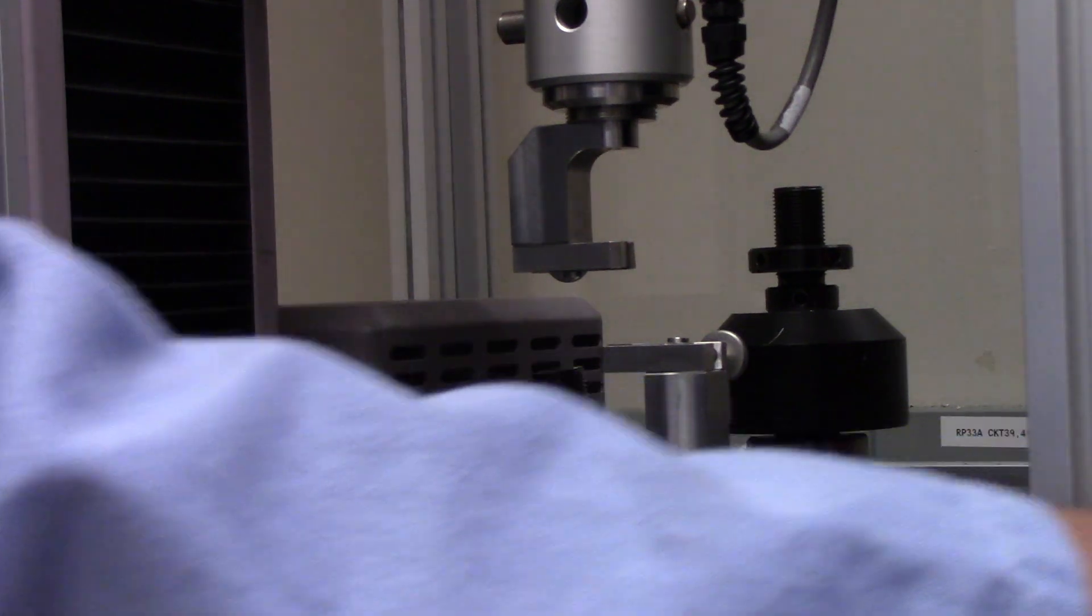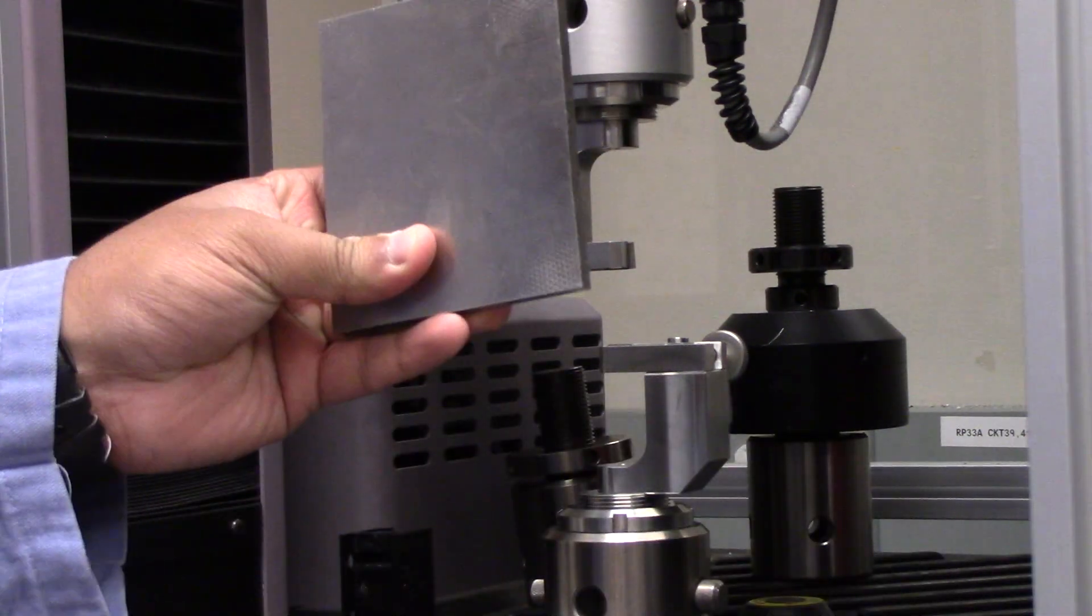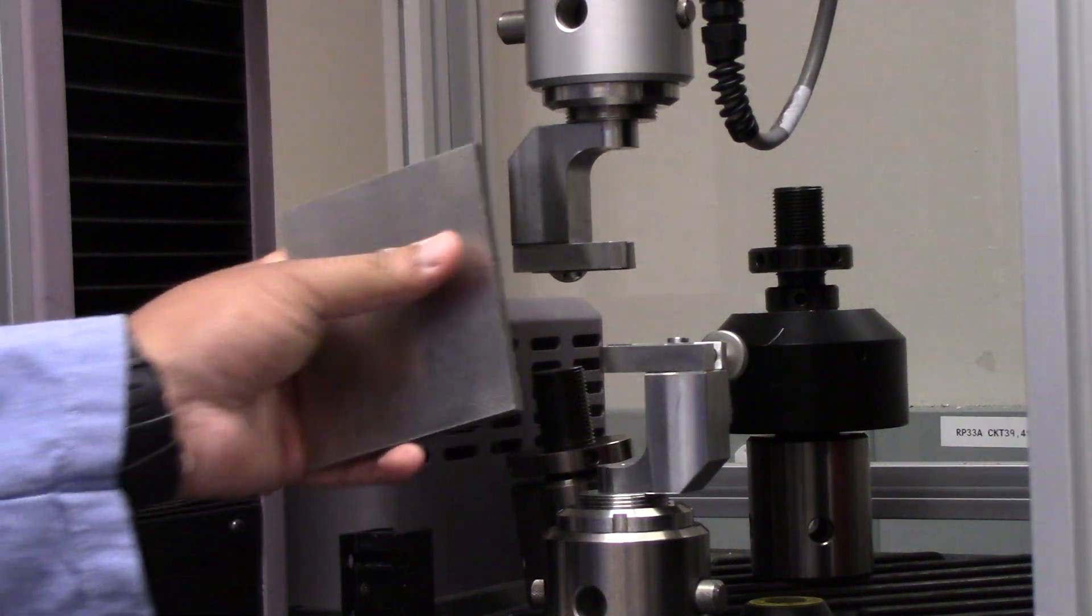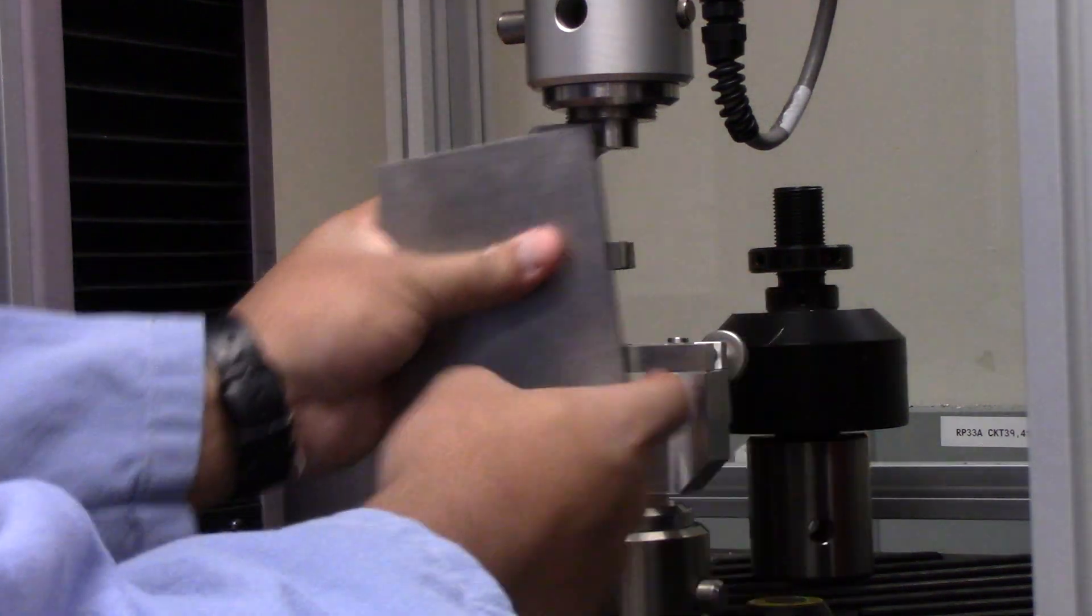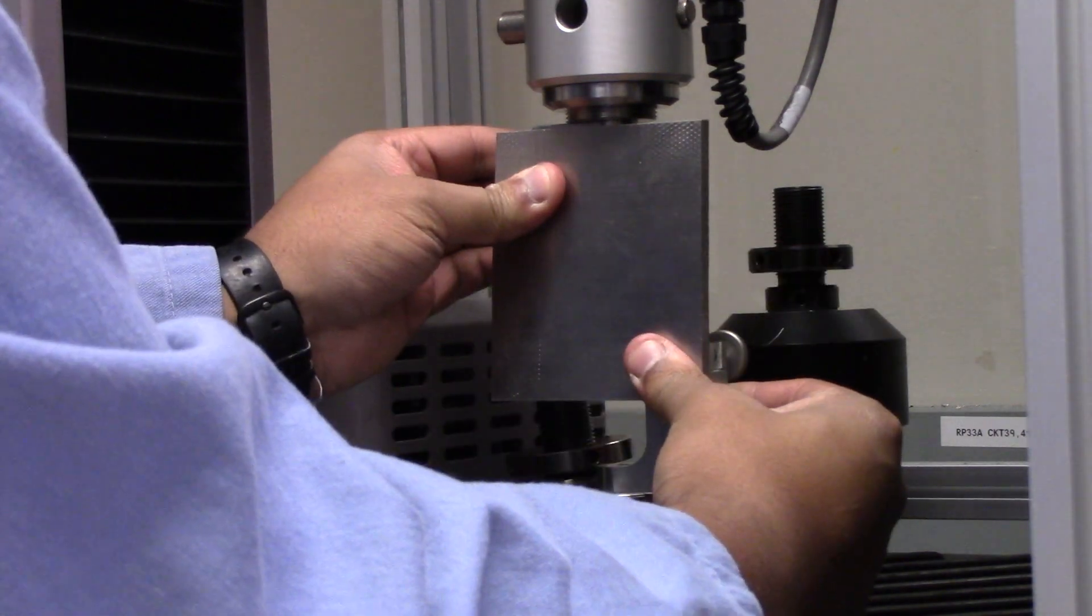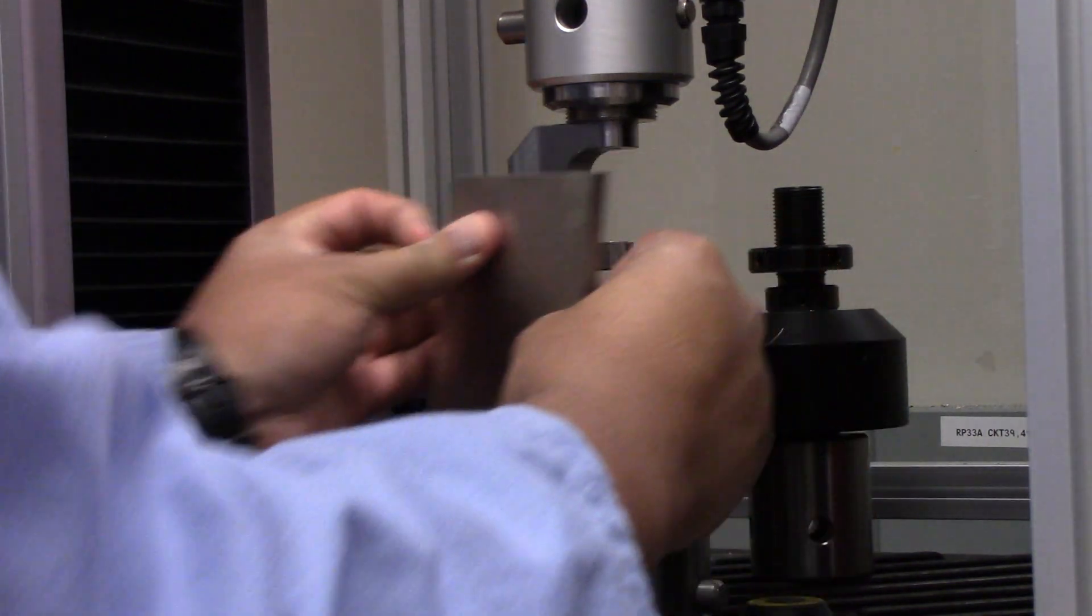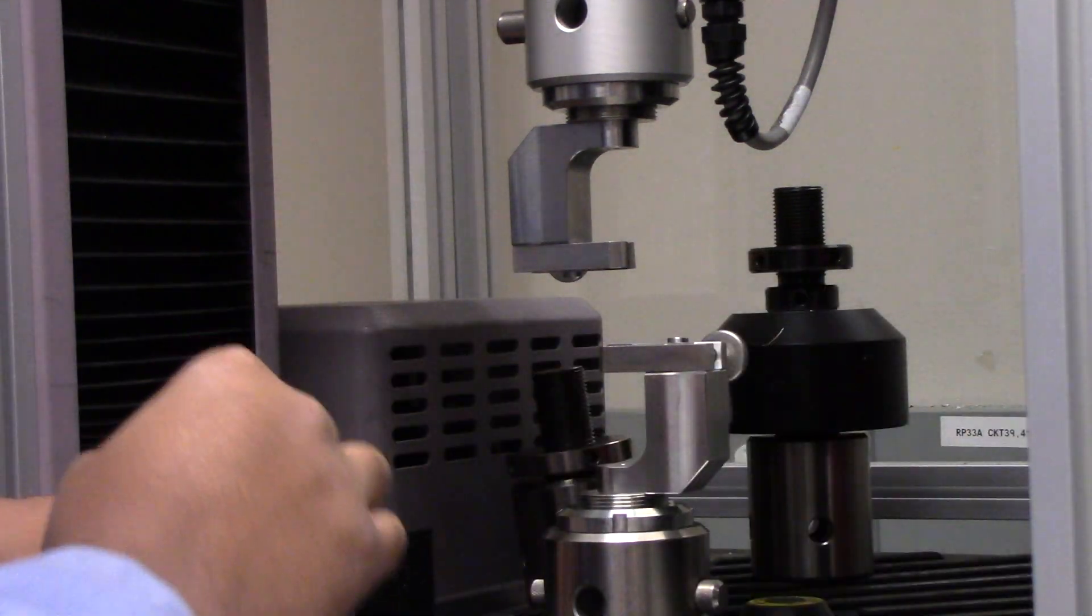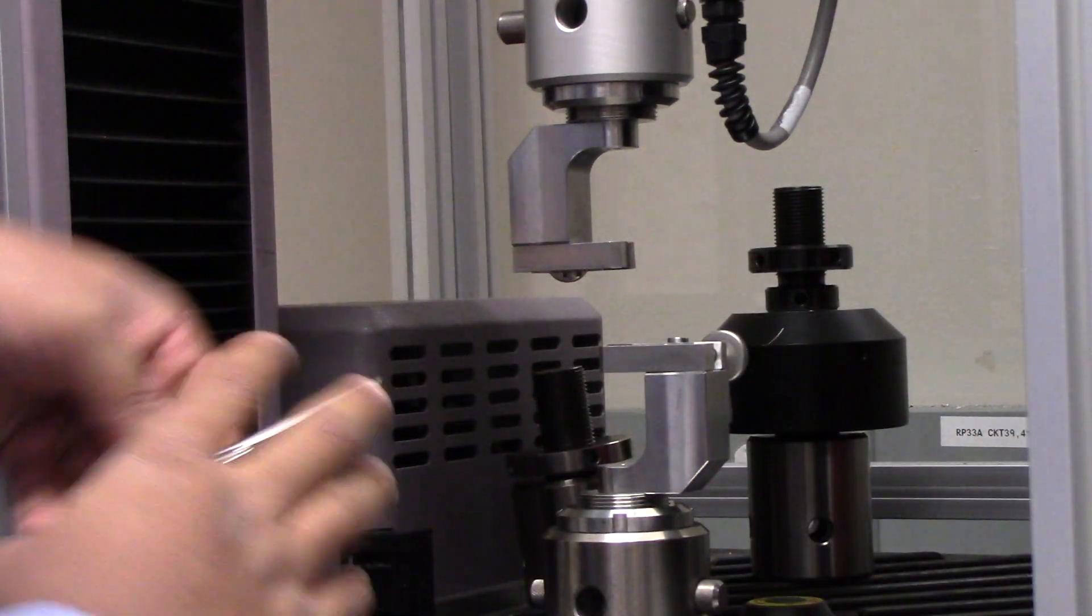Get a nice metal slab, and you'll want to align the lower portion with the higher portion by making these two surfaces flush with each other. Essentially, all that you're going to be doing is pushing it against the plate so that they can be level. Now, when your pieces look nice and straight, you'll want to focus on the upper grip to finish tightening the system.